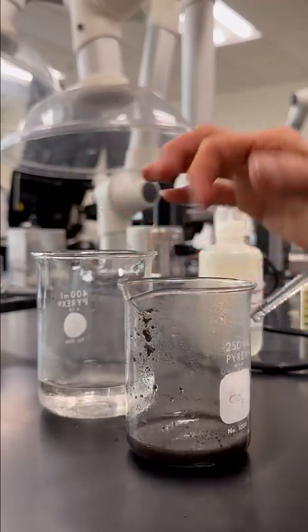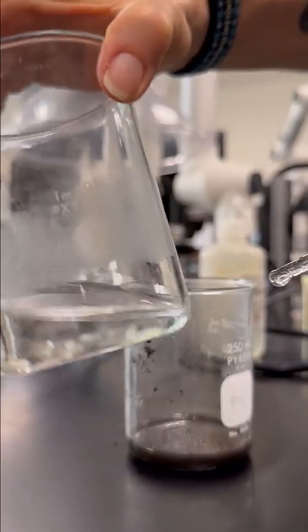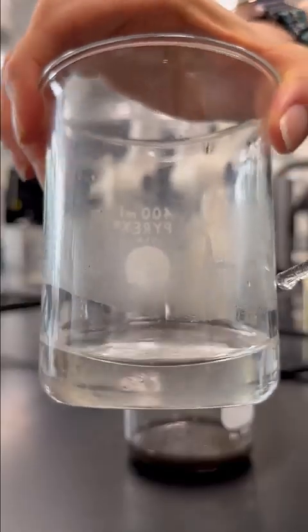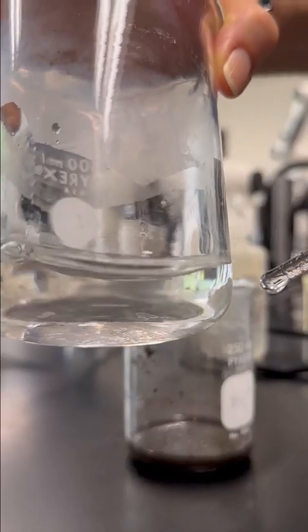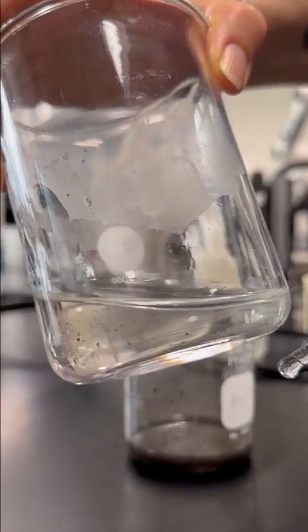All right. And you can see the liquid, I do have a little bit of copper in there, right? So this is a step where I may lose some of my yield because some of that copper is floating around in there in that solution. All right. When you do this, you do it better than I do it.